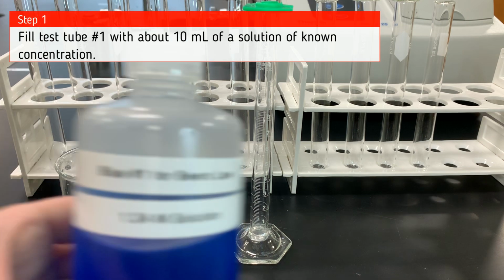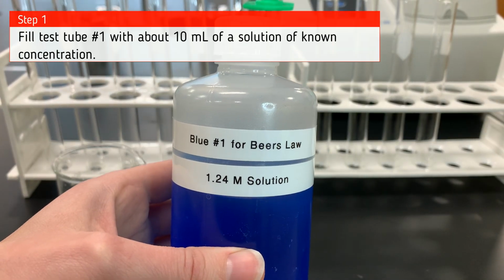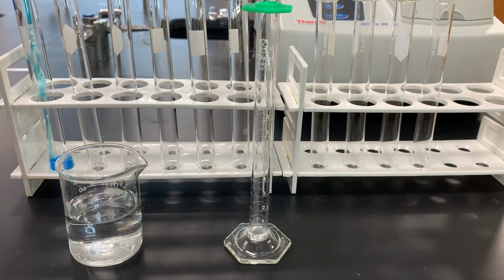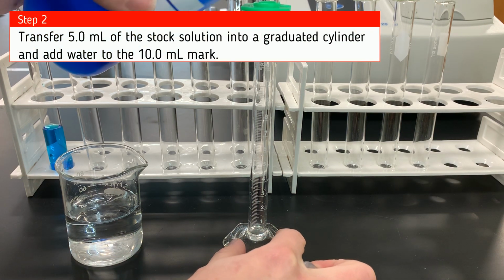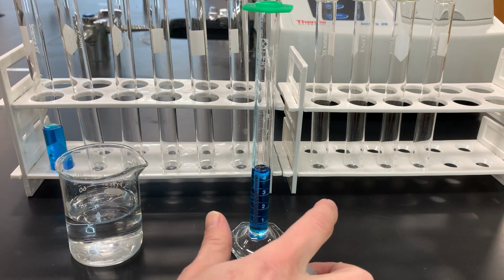This is a 1.24 molar solution, and we're going to fill it about 10 milliliters full in test tube number 1. So we're going to call this test tube number 1, and it contains our concentrated 1.24 molar solution. Then we're going to transfer 5 milliliters of this stock solution into a graduated cylinder, and then add water to the 10 milliliter mark. This will be our first dilution.